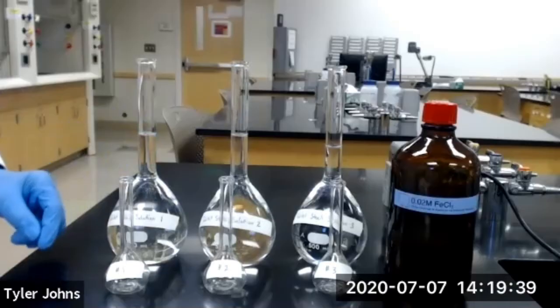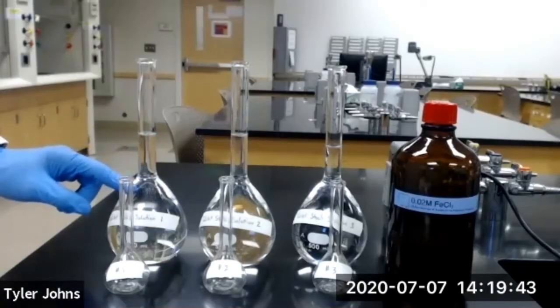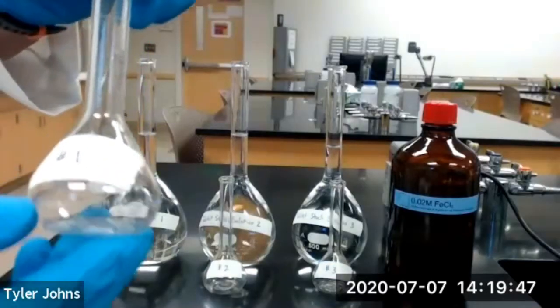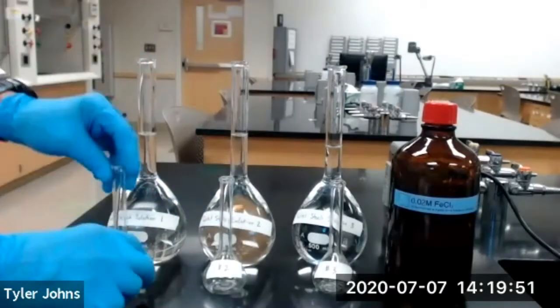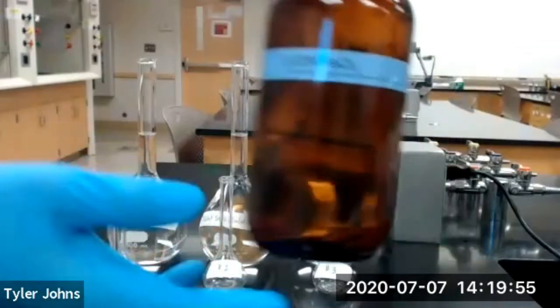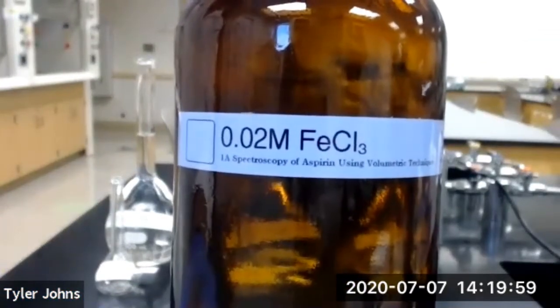So now we're going to transfer 5 milliliters of each tablet stock solution into a corresponding 50 milliliter volumetric flask. We'll then fill to the line with our 0.02 molar iron chloride solution.